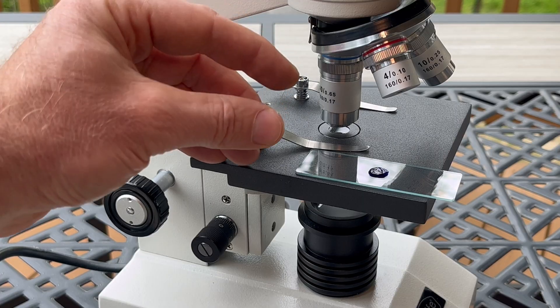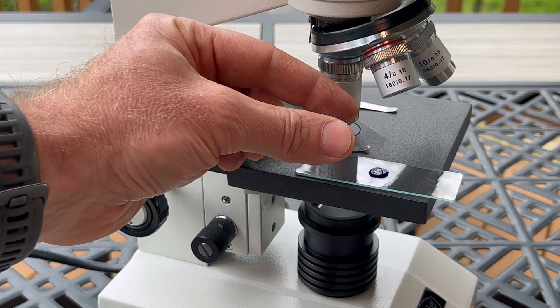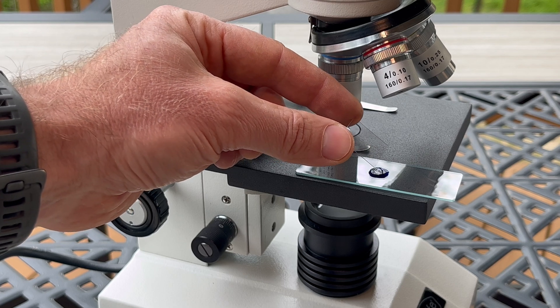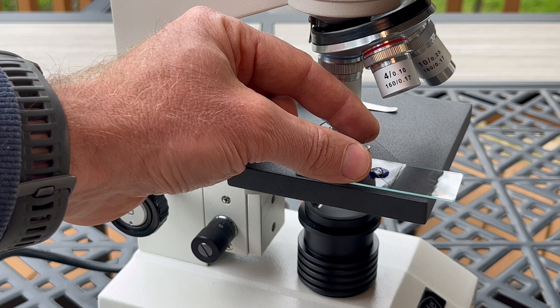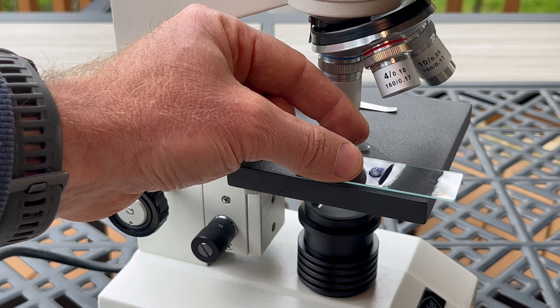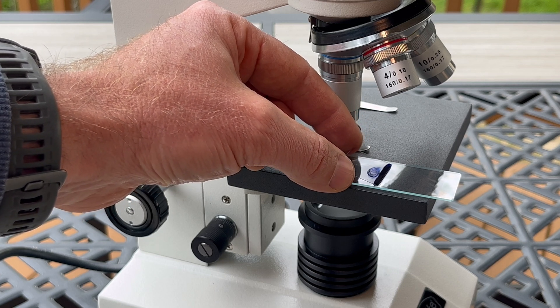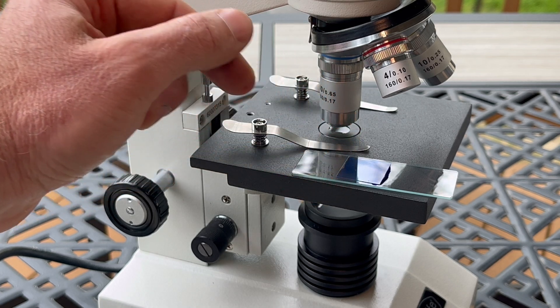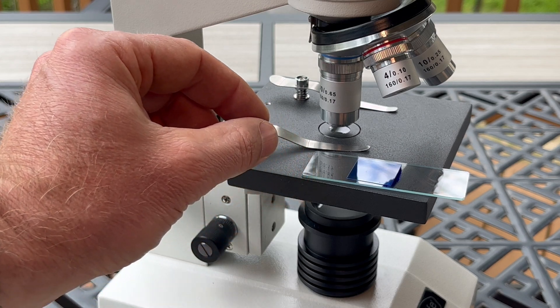The next step is to place the cover slip on top of the specimen. Your goal is to avoid getting air bubbles in the specimen as much as possible. The best approach is to take the cover slip, angle it, start it on one end, and slowly lower it down. Again, the goal is to avoid having air bubbles.